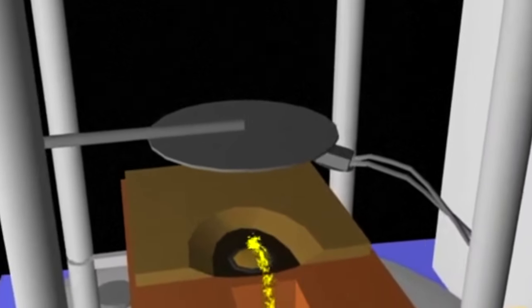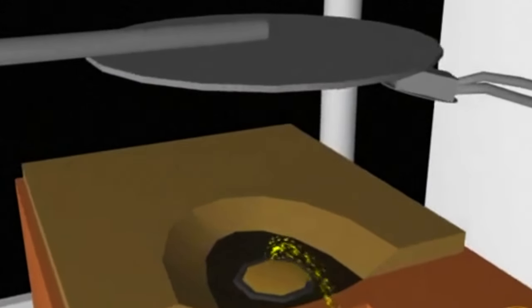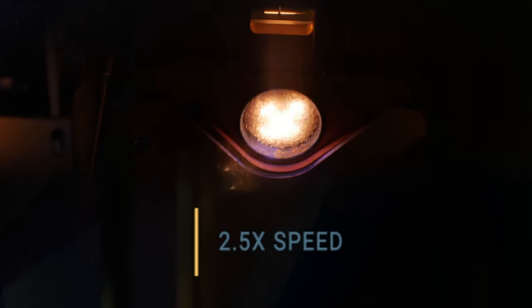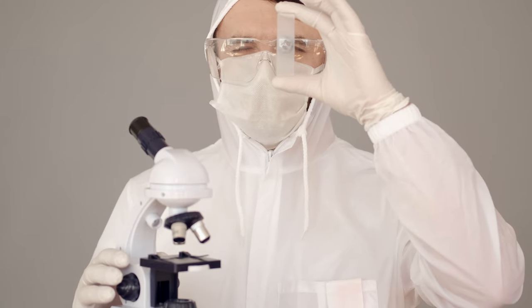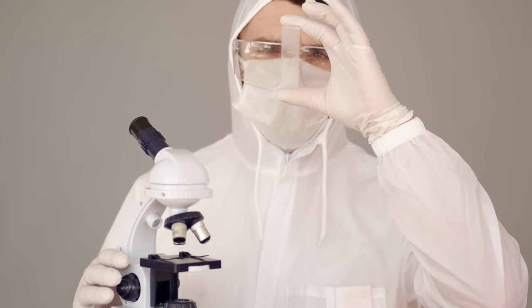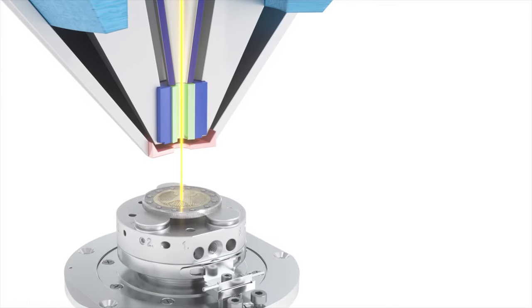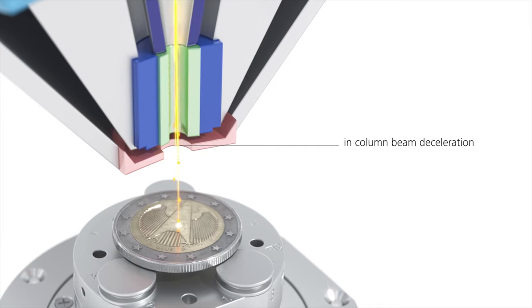If you watched our video about the magic of creating processors, you'll remember that a focused beam of electrons is used to vaporize material, and the source of these electrons is a tungsten filament. In an electron microscope, everything is roughly the same — tungsten is also often used as a source of electrons. The thin thread heats up to high temperatures and begins to emit electrons in large quantities, and then the fun begins.